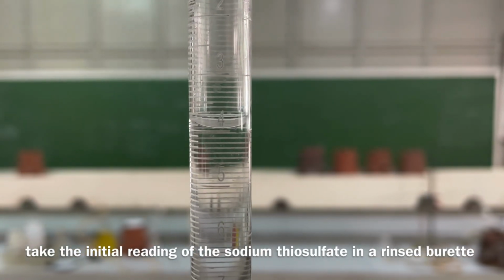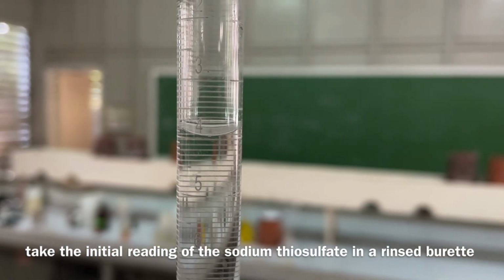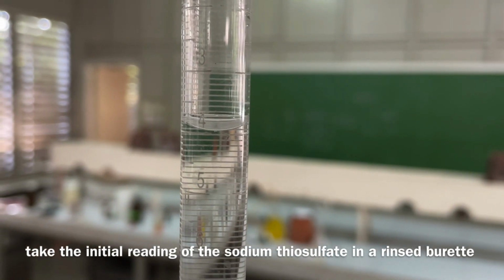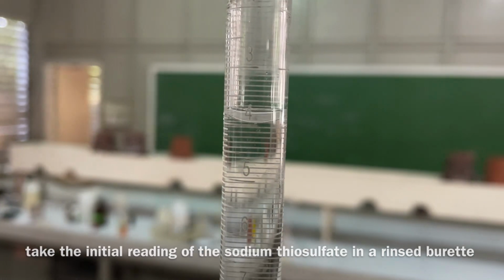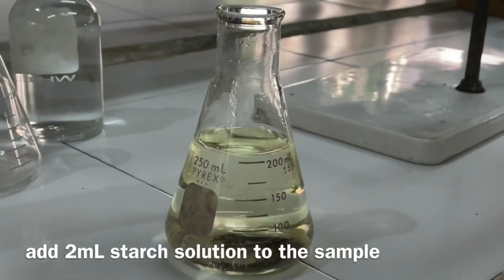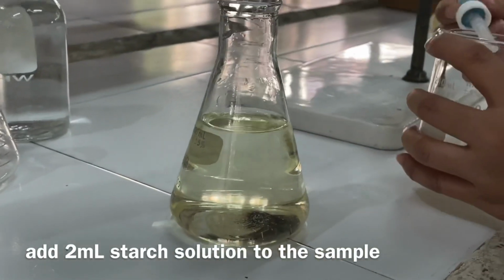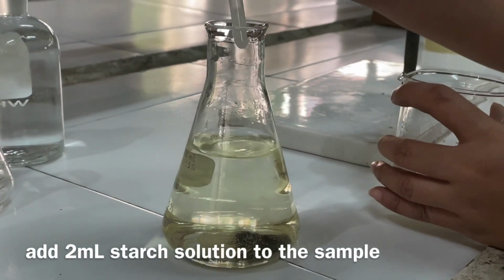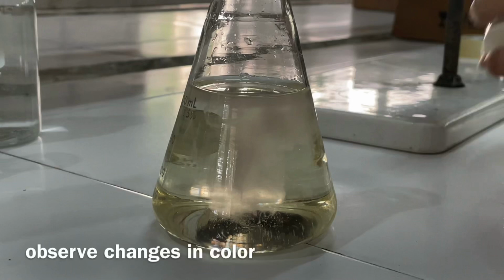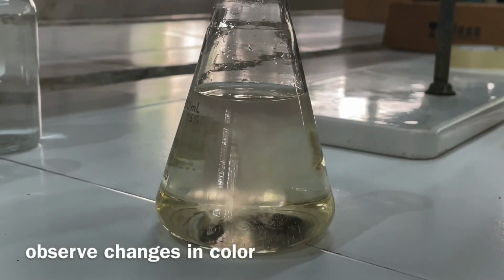Take the initial reading of the volume of sodium thiosulfate solution inside the burette, which has been previously rinsed with the same solution. Add 2 milliliters of the starch solution into the sample in the Erlenmeyer flask. Make sure to take note of the changes in the color of the sample.